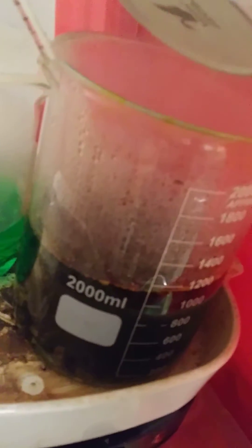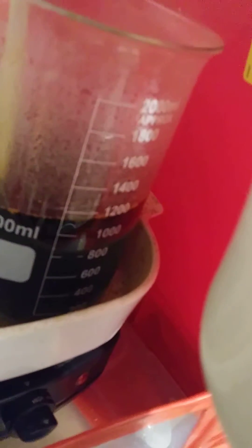I use a little dripper bottle, and once it's all said and done, just give it a couple of quick stirs and shakes — just like that I've got instant stannous. Now let me give you guys a quick test. These are the 8086 chips and they are pretty much done.